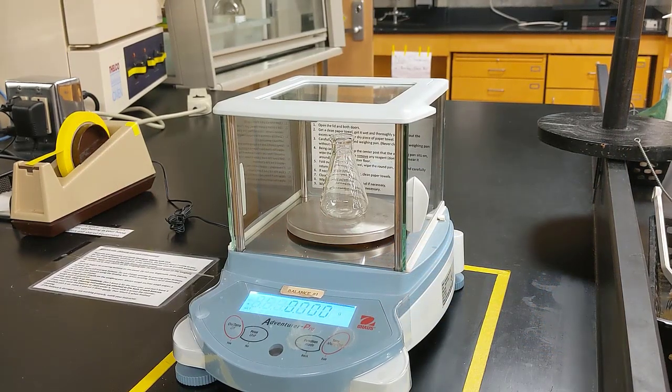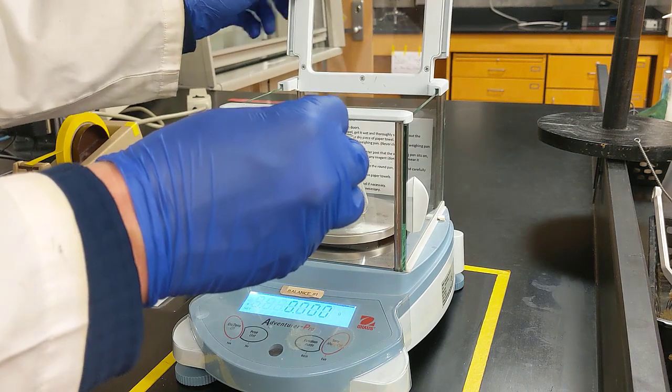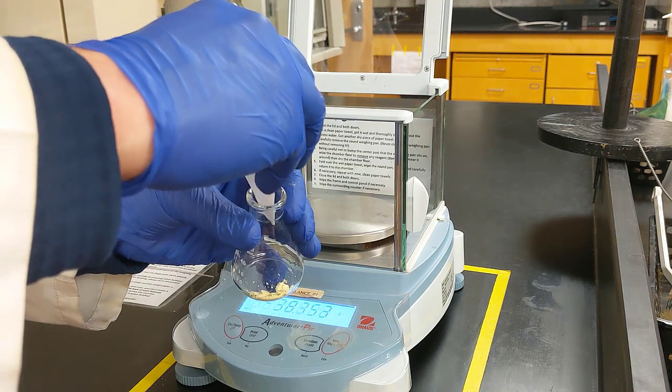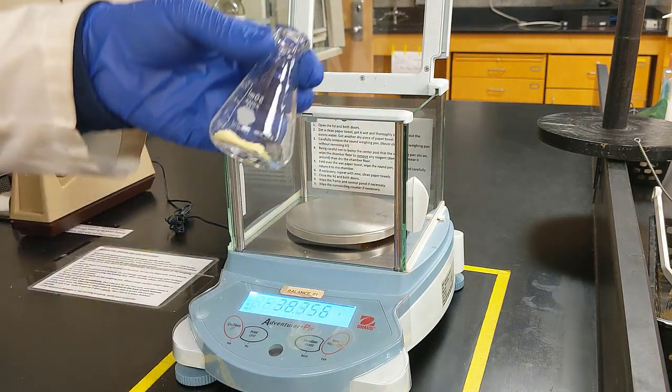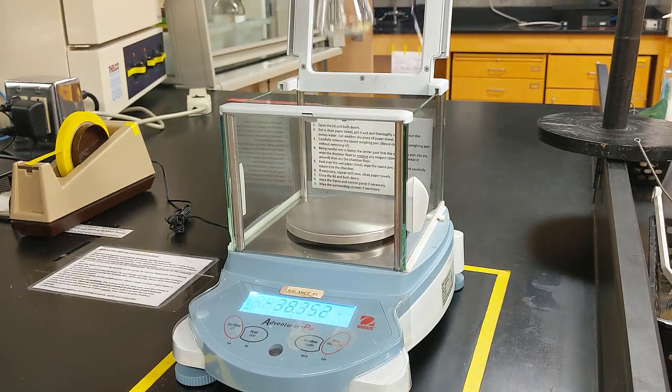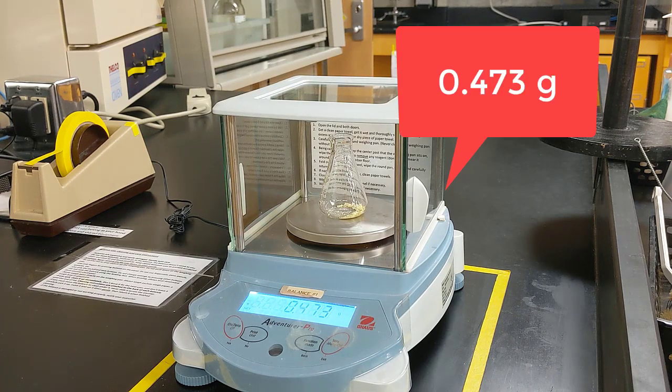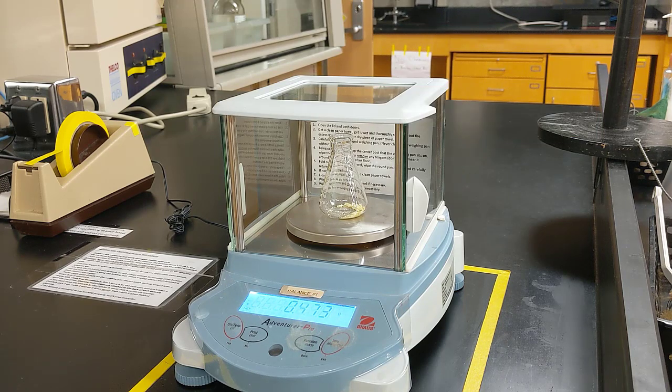Alright, the next thing I want to do is tare a small Erlenmeyer flask and then get the mass of my crude product. So let's go ahead and do that. The crude product is a yellow powder. I've got it on a piece of weigh paper here. And I'll just dump all of that kind of clumpy yellow powder into the inside of this small Erlenmeyer flask. So that's my crude product. Let's see what the mass is so we can record that for our lab data. So it looks like 0.473 grams is the mass of our crude product. Let's go ahead and recrystallize that using 90% ethanol and water.